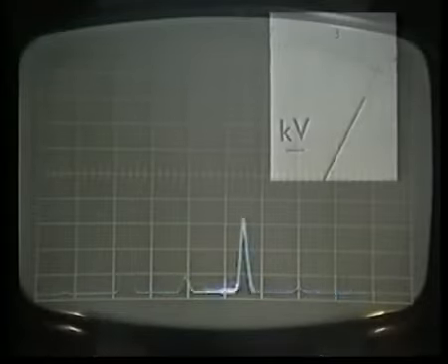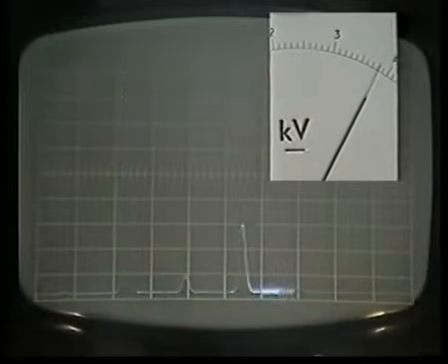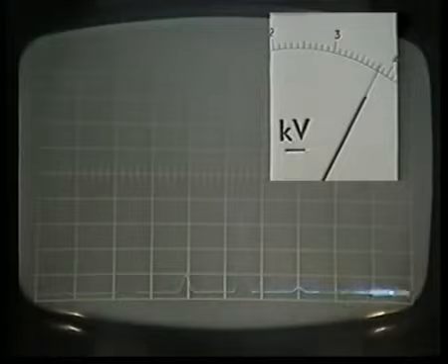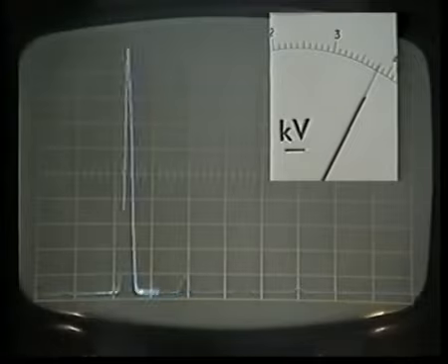Here, you can see the effect of changing V over a narrow range. In this case, around 3.8 kilovolts. Varying the voltage V is easier to do quickly than to change the magnetic field B by changing the current in the electromagnet's coils. This is because these coils have such a high inductance. So, for a fast scanning rate, V is varied and the current in the electromagnet's coils is kept constant.